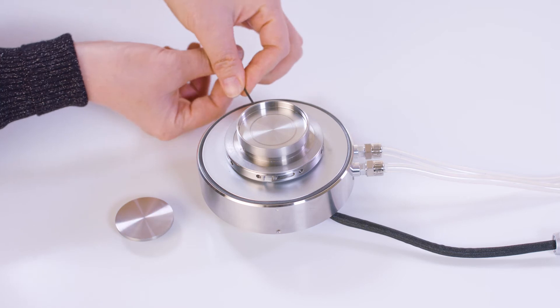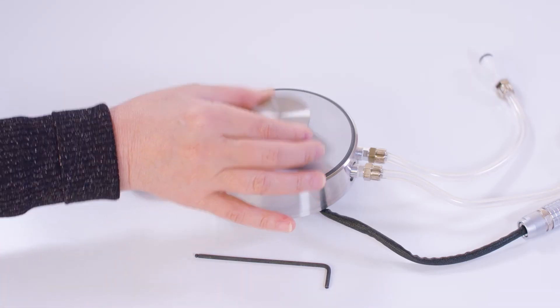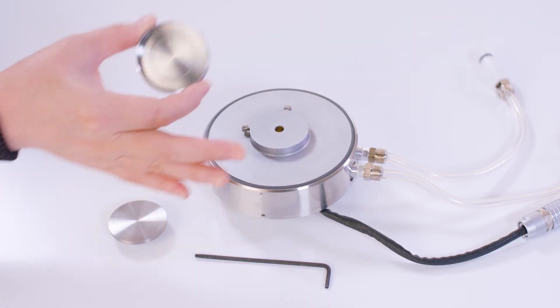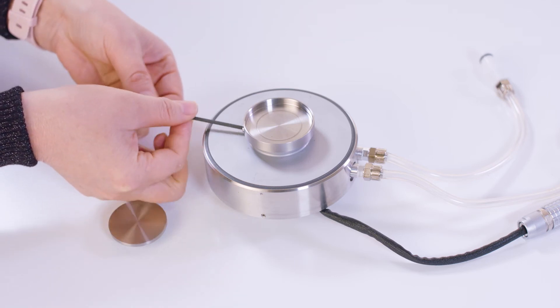For disposable Peltier plate users, you can directly insert this disposable plate or cup to the Peltier. After that, install this Peltier to the bottom of the rheometer.